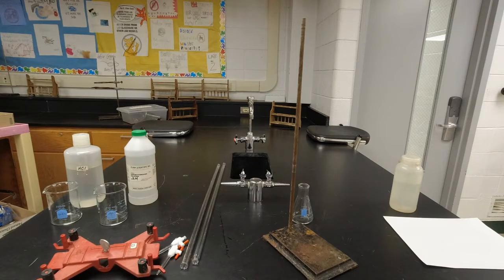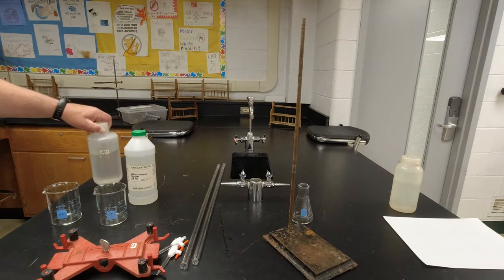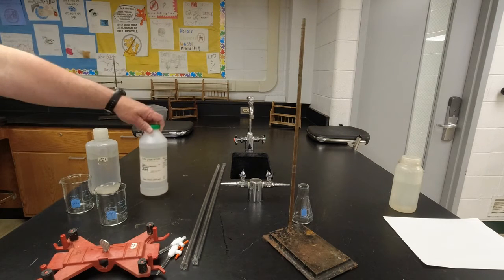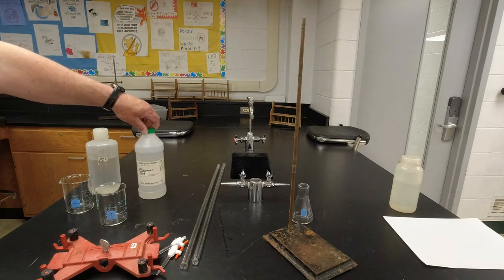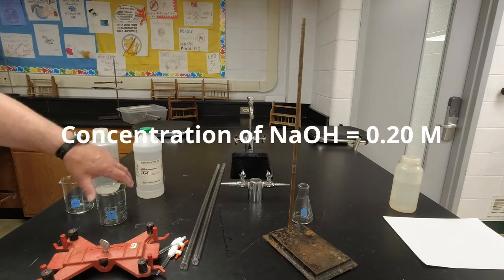All right, so here are the materials that we're going to need for this lab. Obviously, we're going to need some acid, and so here is a bottle of acid. We don't know its concentration. I'm going to use this beaker for the acid. Here's our known solution of sodium hydroxide. It's 0.20 molar. Good thing to remember, 0.20 molar for the base. You're going to need that for the concentration.